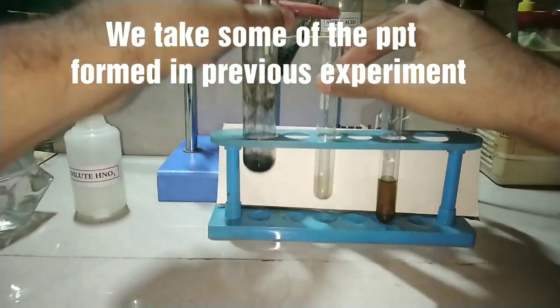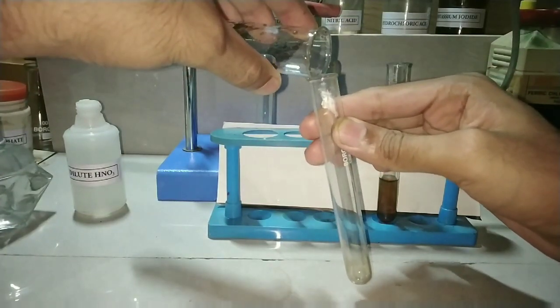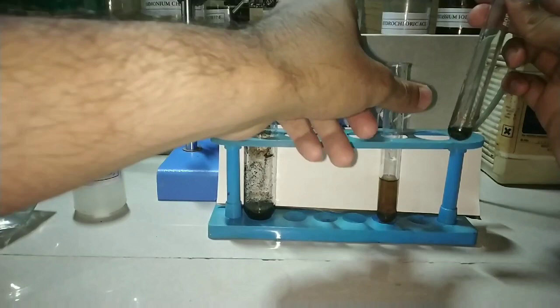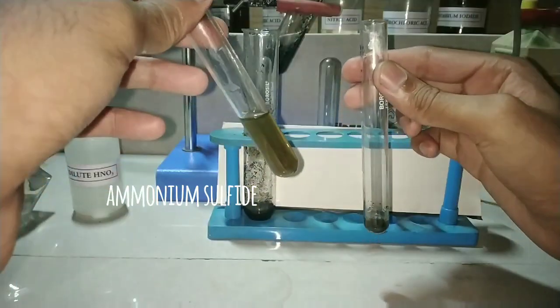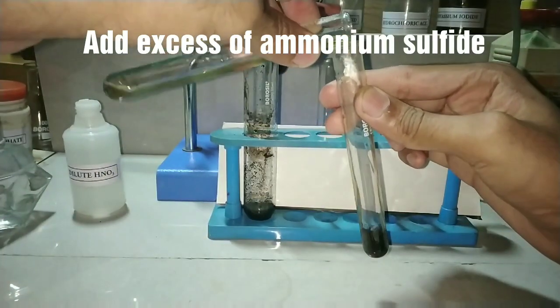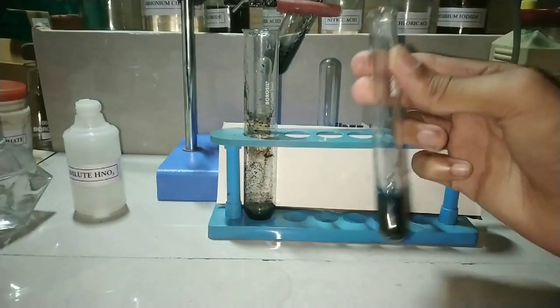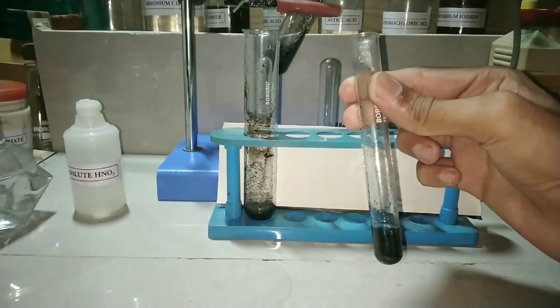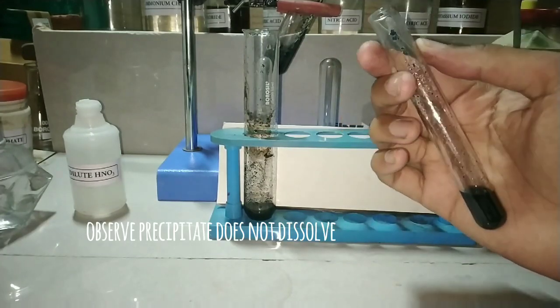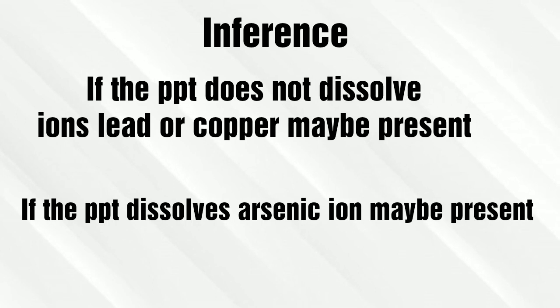For this we take some of the precipitate formed in the previous experiment. Now we will be adding ammonium sulfide solution, that is yellow in color as you can see. On adding that, we see that the precipitate does not dissolve. If the precipitate does not dissolve, copper ions may be present.